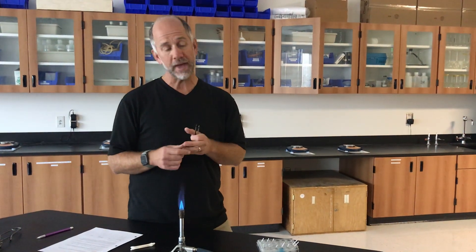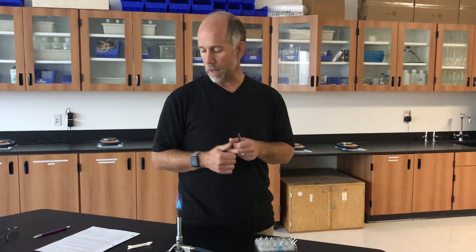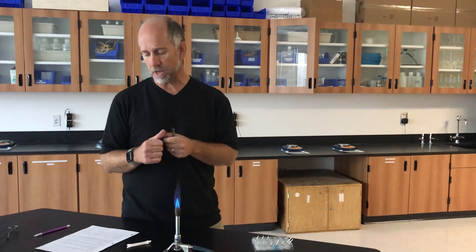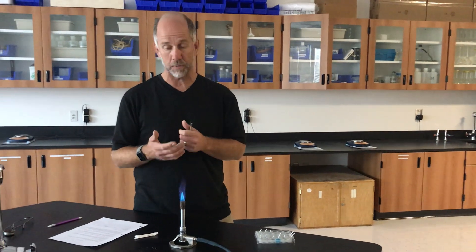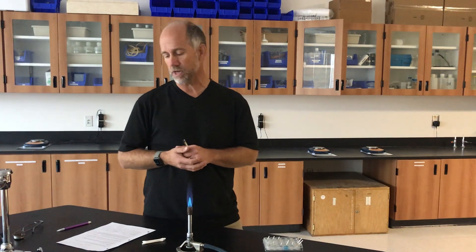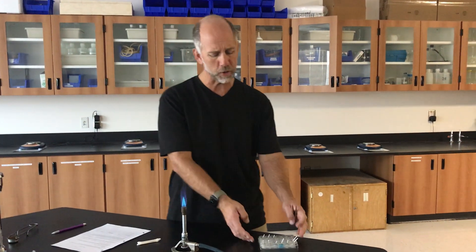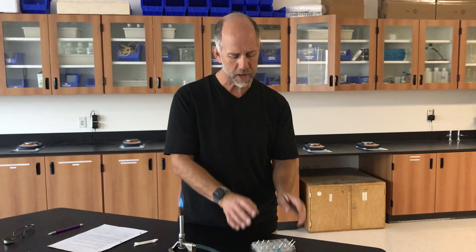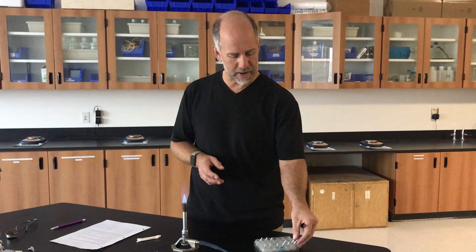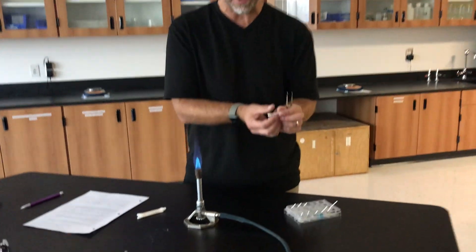We have barium, calcium, copper, then potassium, lithium, sodium, and strontium. And then we have three unknowns that we'll be looking at down in step six of the lab. We've already broken up our Q-tips, and they've been soaking for a little while, and we are now ready to flame test these metals.